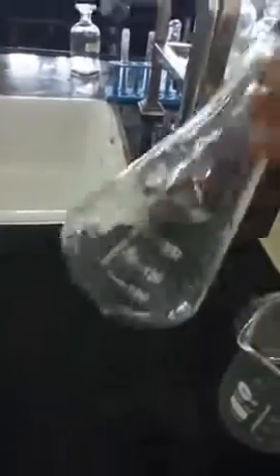This is actually the flask which is used for the titration. This is called as conical flask. When you do the titration, the solution from the pipette is allowed to fall into this.